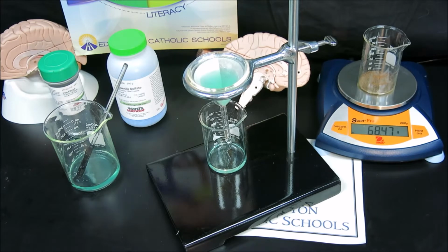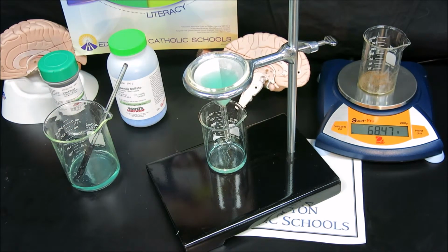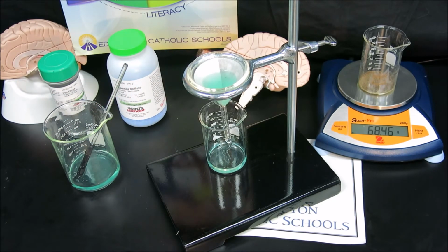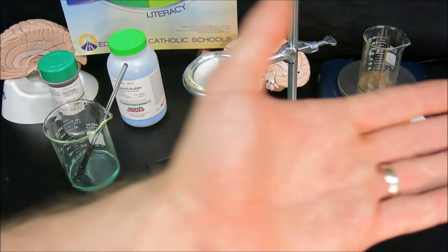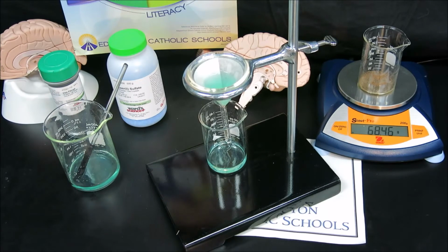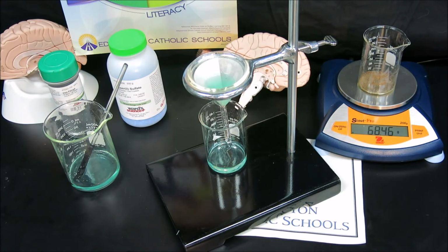And in future lab experiments, if you need to test the ions that are present in the filtrate, you could test them by adding a precipitating ion to it and filtering out any of the precipitate into a filter, and then retesting the filtrate to see if any of those ions are still present or to see if other ions are present. So either using a heating drying method, as we did with the copper, or a filtration method, as we're doing here with our waste beaker, either one would collect your solid and dry your solid.